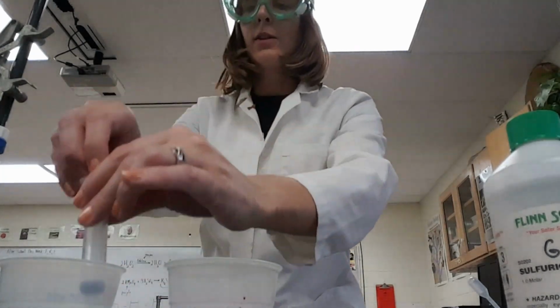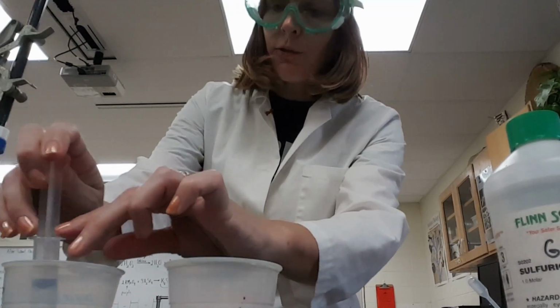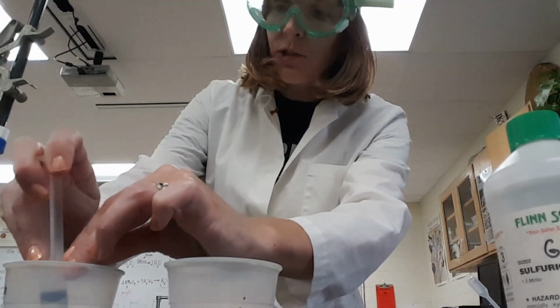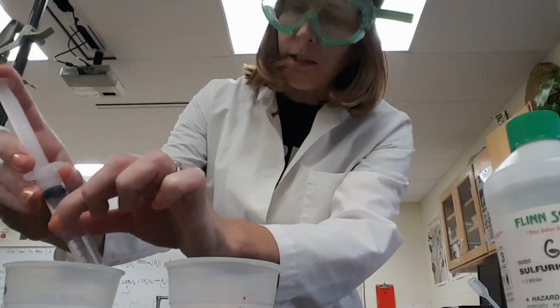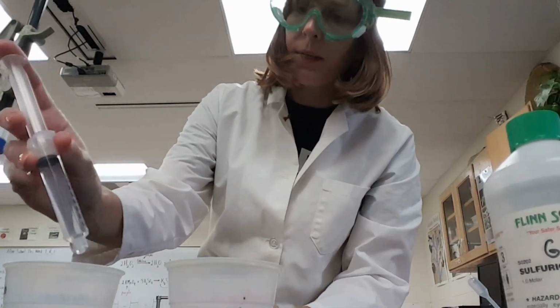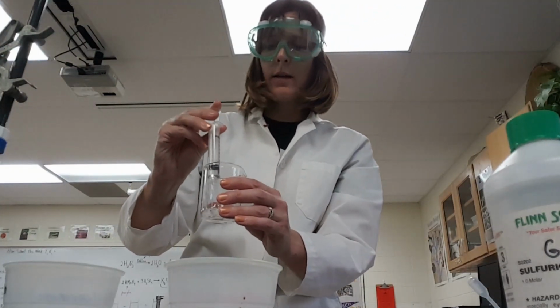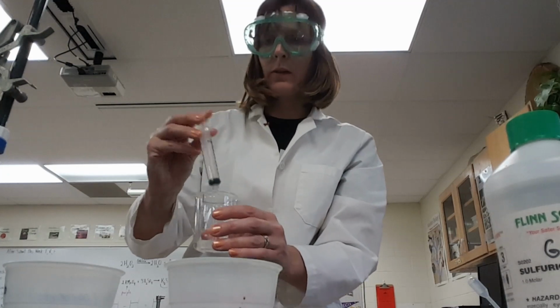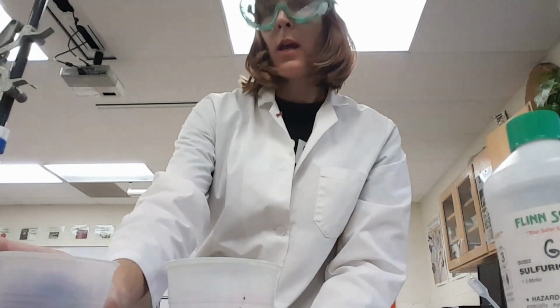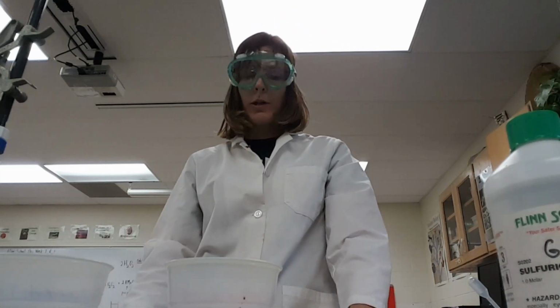So I'm going to take with my syringe, that is my hydrogen peroxide syringe, I'm going to very carefully measure out 10 milliliters. Milliliters are the same as cc's, but I think these are labeled milliliters anyway. And you're going to put that into a beaker. Okay, so that part's done. All right, then this would be the step where you would be adding the catalase, the enzyme, if you were going to be doing an enzyme trial, but this is just the baseline trial.